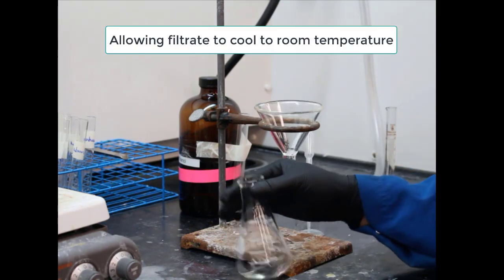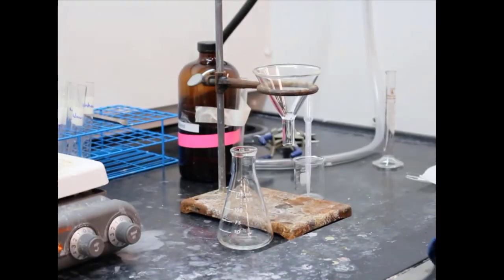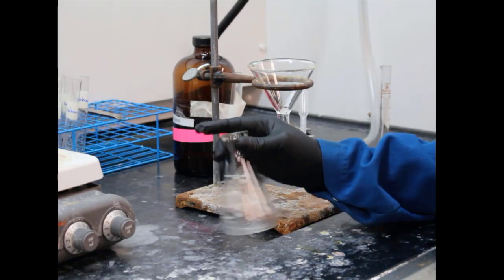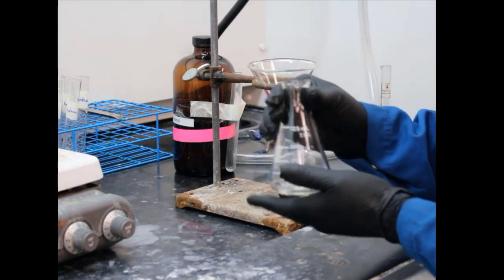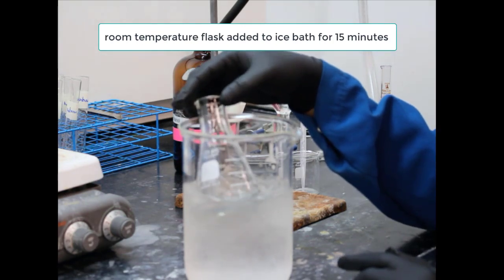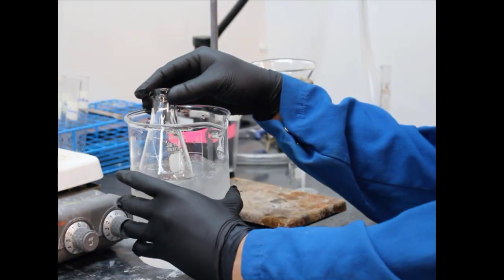Ew, they look nasty. All right, now they're going to allow the filtrate to cool to room temperature. Now this is so that the recrystallization can begin. Remember, the unknown does recrystallize as it reaches room temperature, but to maximize the recrystallization, having all of your unknown precipitate out of solution, you want as cool a solvent as possible, right? Because we know that solubility is dependent on temperature. So the lower the temperature, the less soluble compounds tend to be. All right, so they're putting it in the ice bath after the beaker reached room temperature.